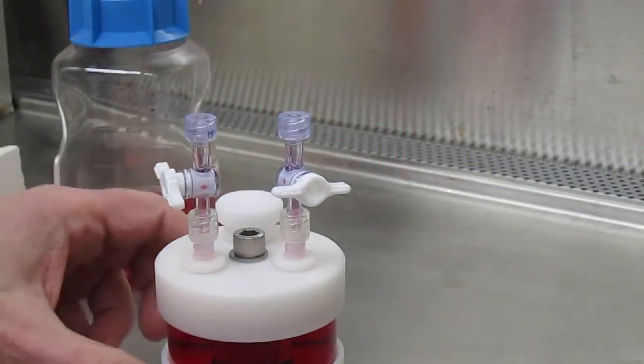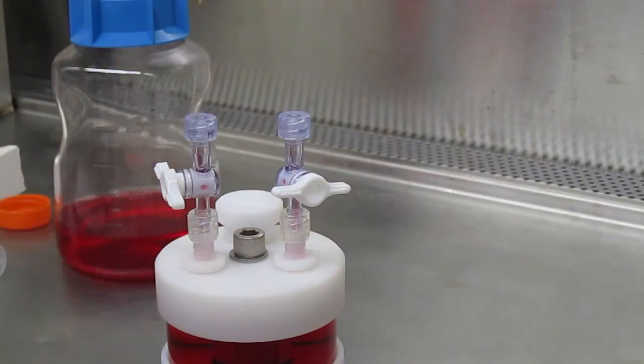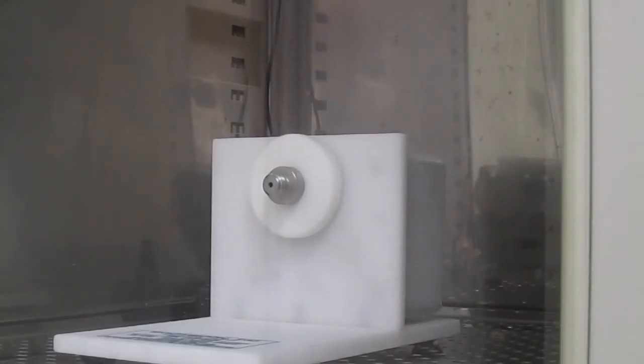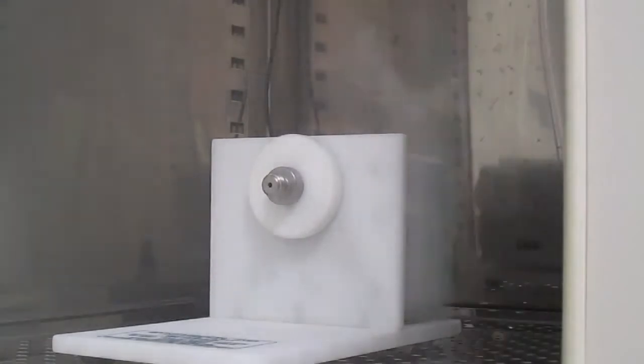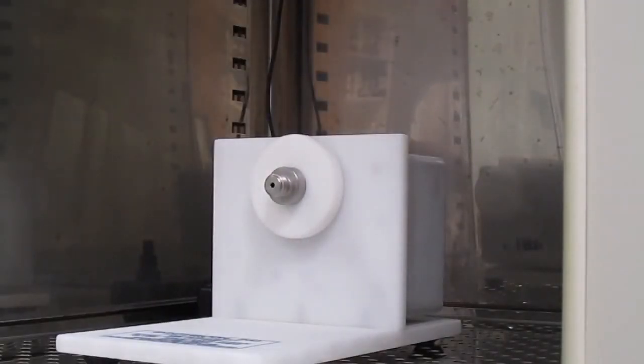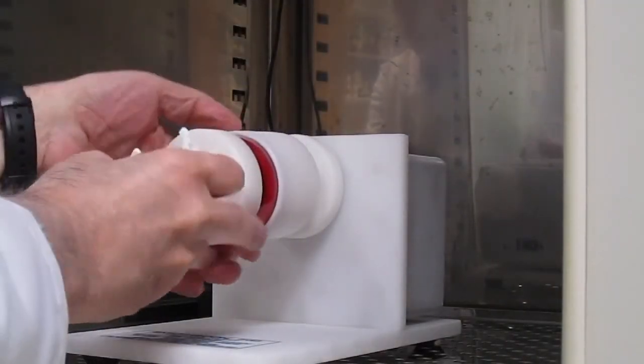The vessel is ready to be placed on the rotator base. The rotator base is in the incubator and the vessel is placed on the base by screwing it in to the base.